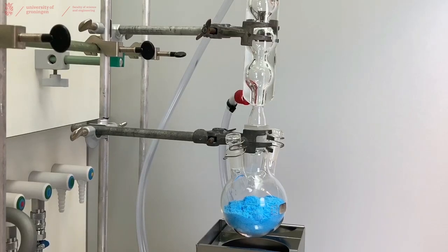In this video we will demonstrate how to do a recrystallization using the setup we built in the previous video on how to build a reflux setup.